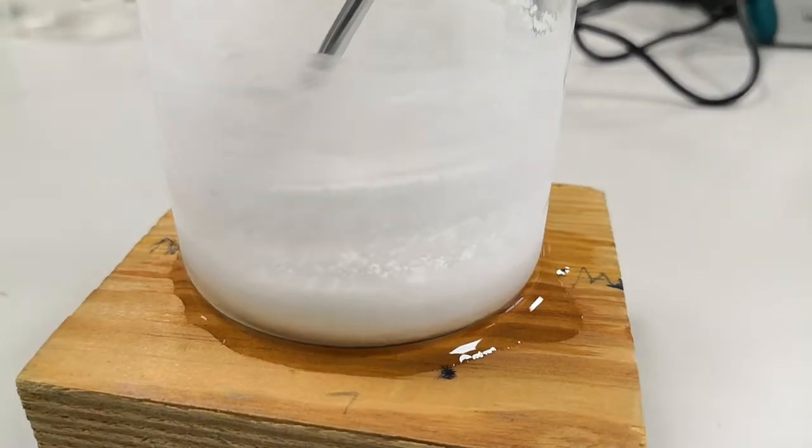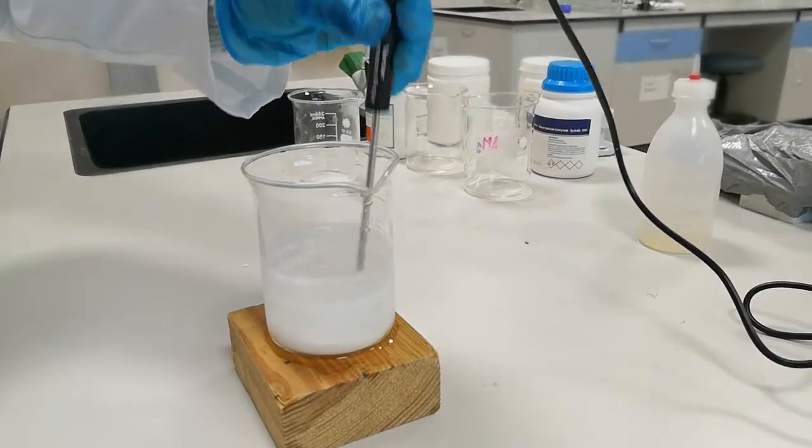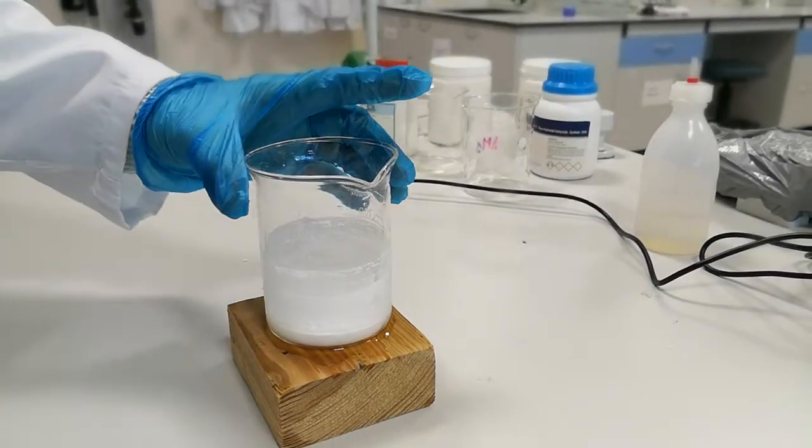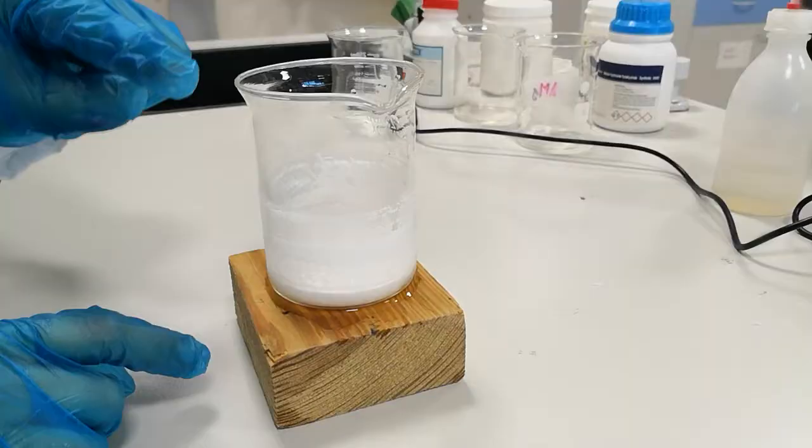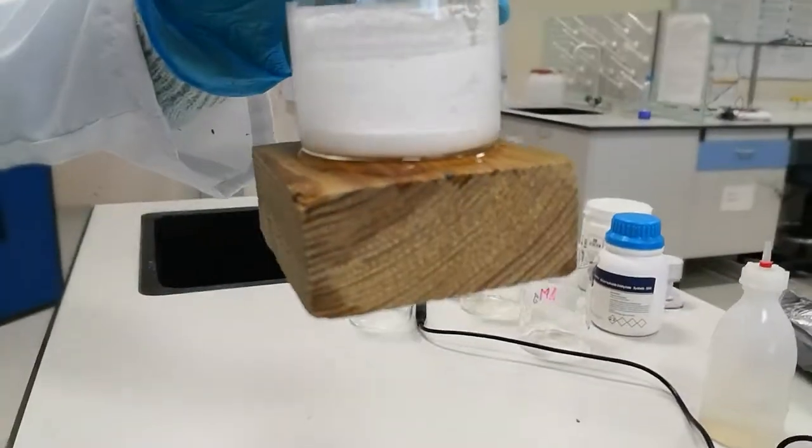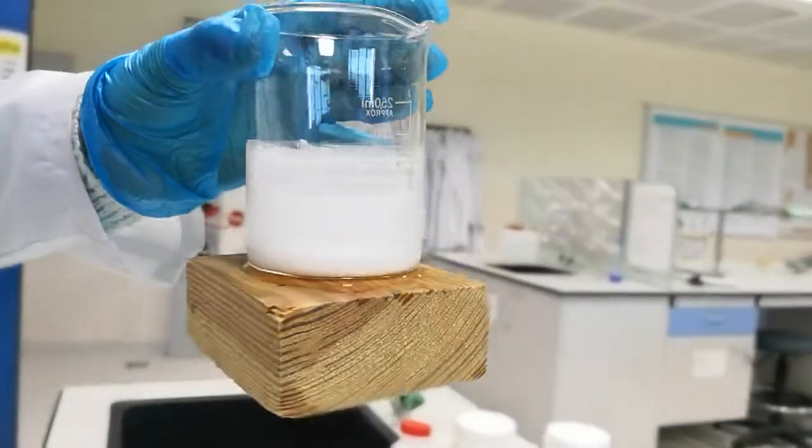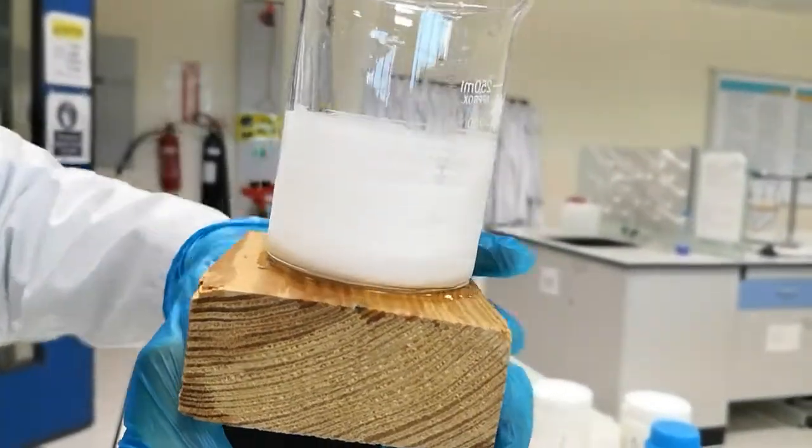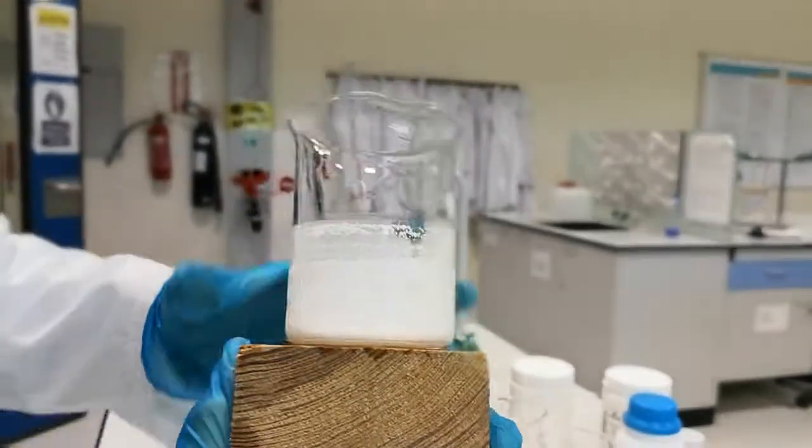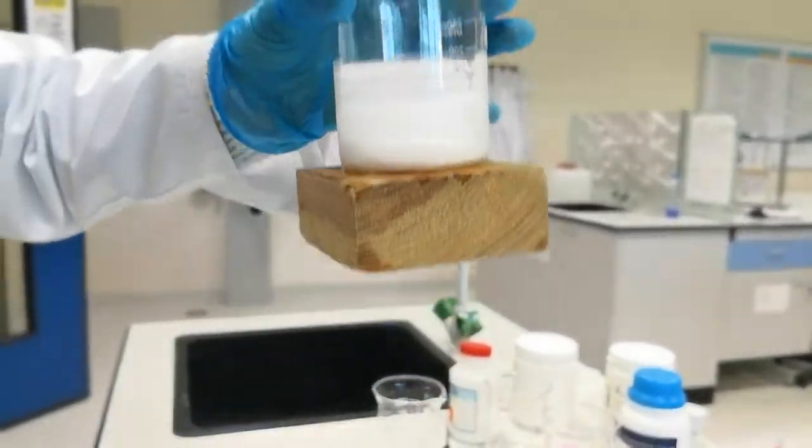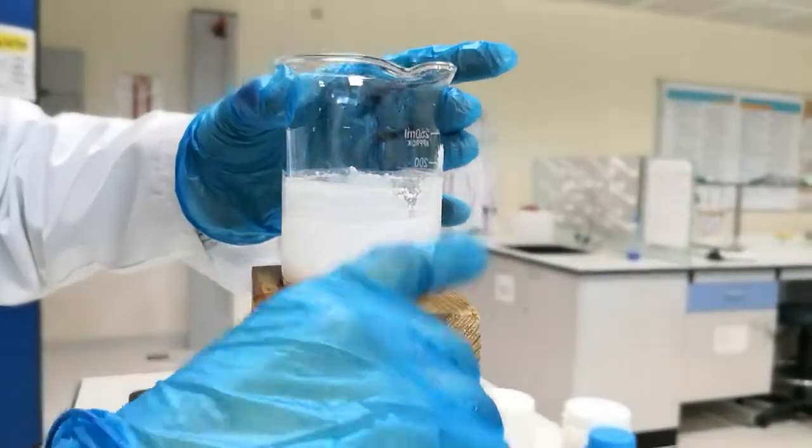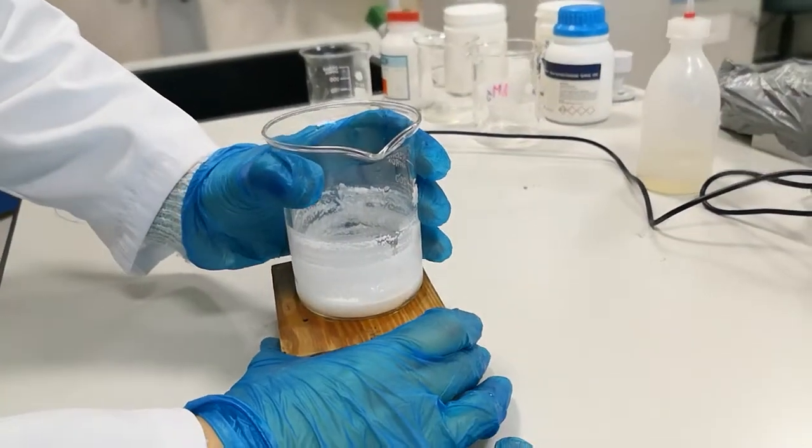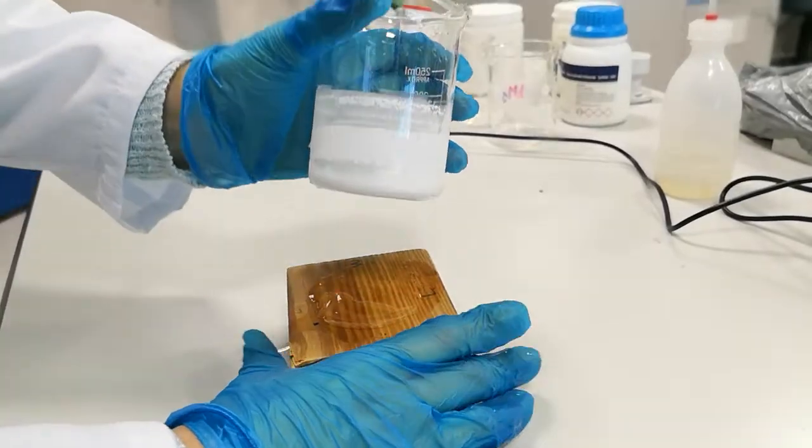It is really cold. Now after the reaction finished, I'm going to lift this up and I expect the water that was between the beaker and the piece of wood froze. So no matter how hard I try to separate them, it's just sticking. I'll try to keep it for a while. Okay, so here we go.